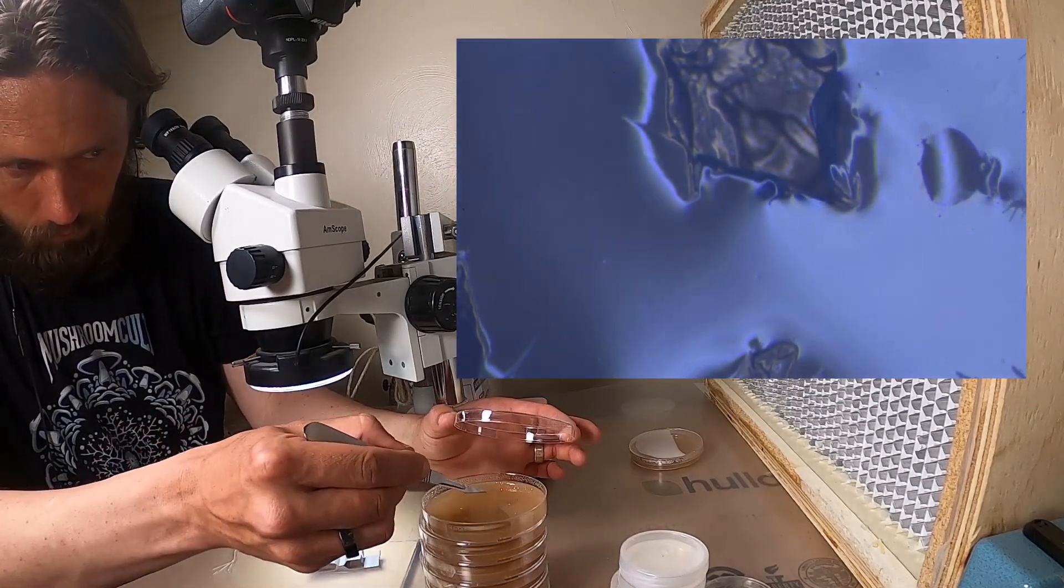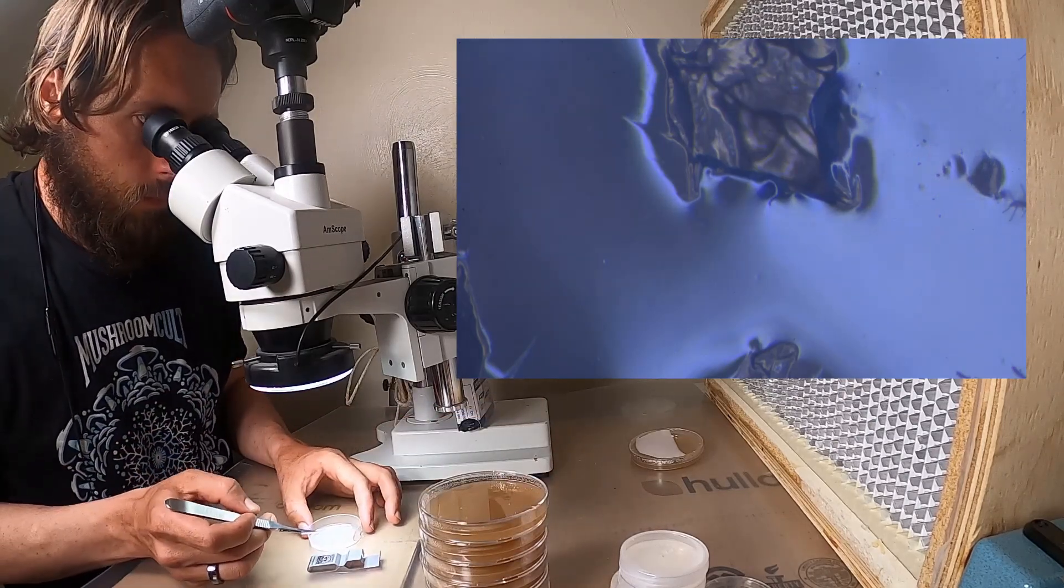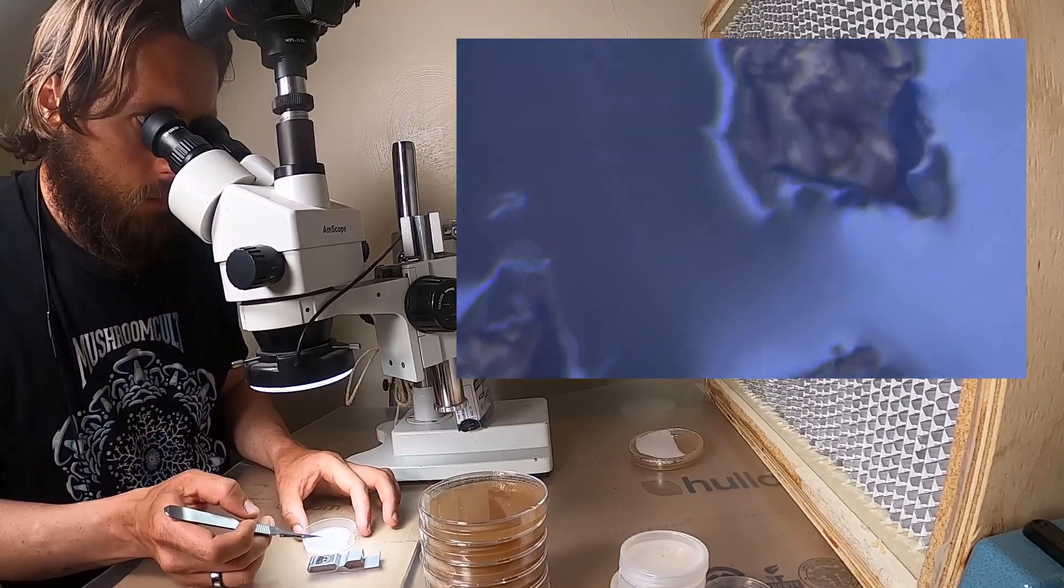Again, I'll put it on that plate. I'm just trying to separate a bunch of colonies that I'll divide up later after I've proven that they've succeeded.